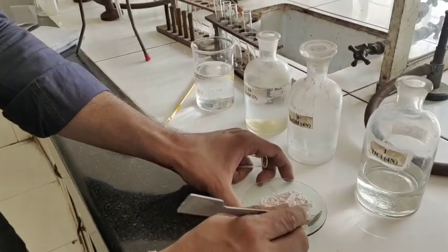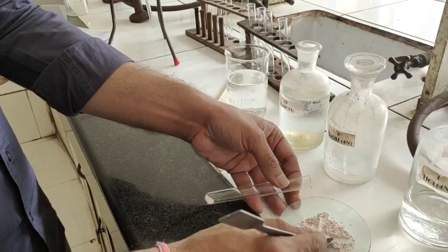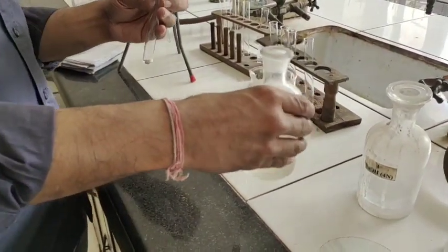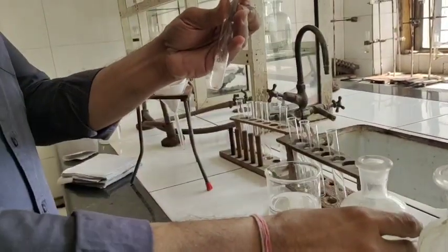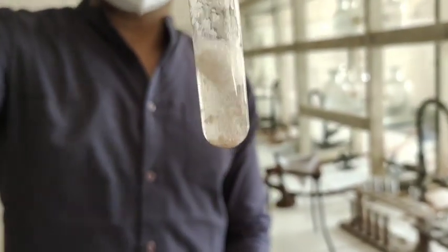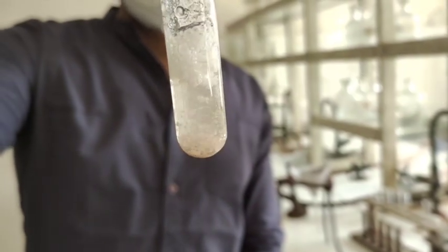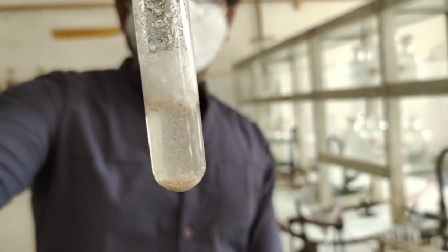Next — we are done with the solubility part. The next part is carboxylic acid. I take a small amount of the mixture and add sodium bicarbonate. Now if you remember the reaction, if there are carboxylic acids present, I will see effervescence. Yes — can you see effervescence here? I can see it, and of course you can also see it. One thing is for sure: one of the organic compounds is carboxylic acid.